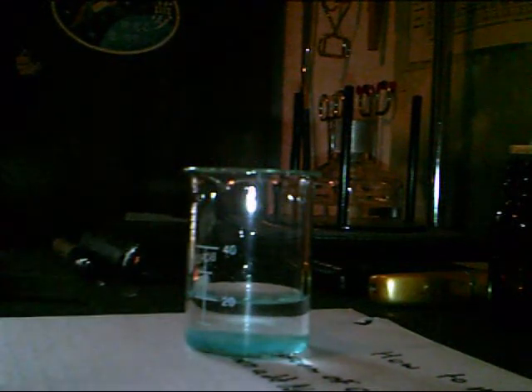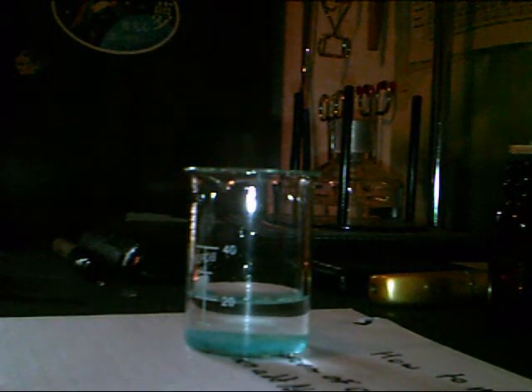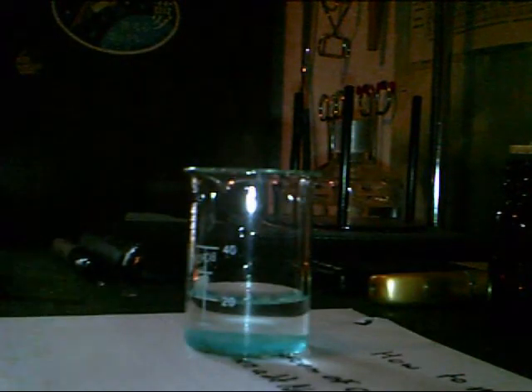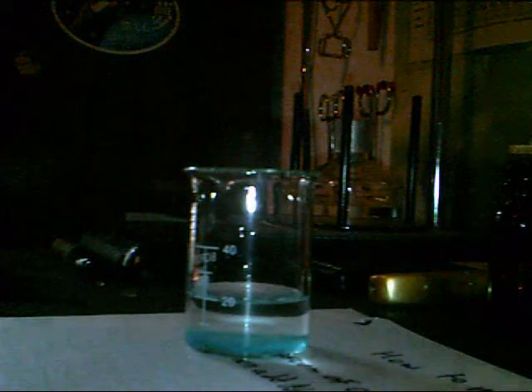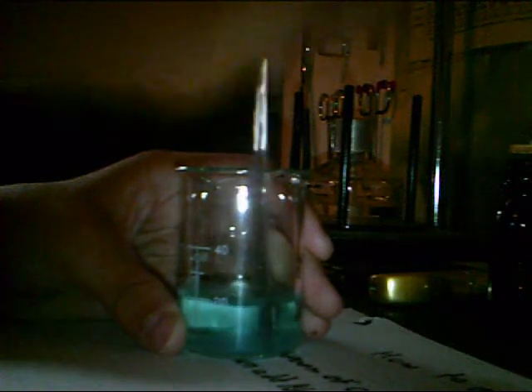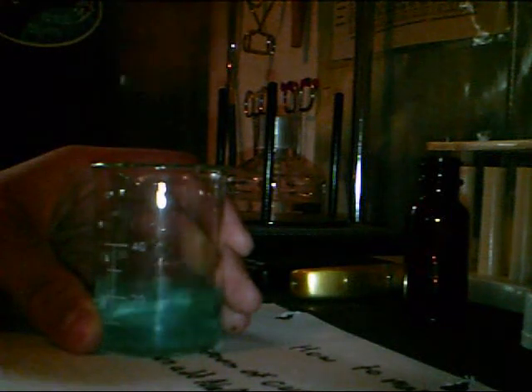You will mix them and dissolve them. Now, what you need to do is pour this - first you need to dissolve most of it. I recommend that you dissolve the copper sulfate first, but you can do the method that I used too. I messed up, unfortunately.